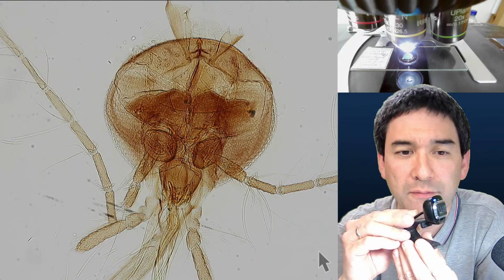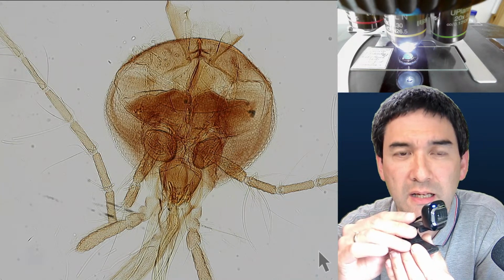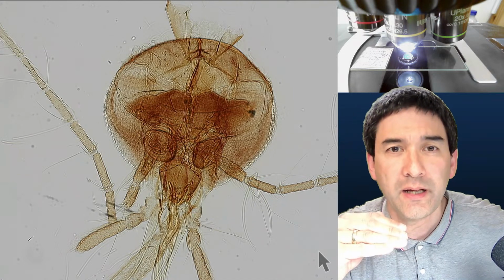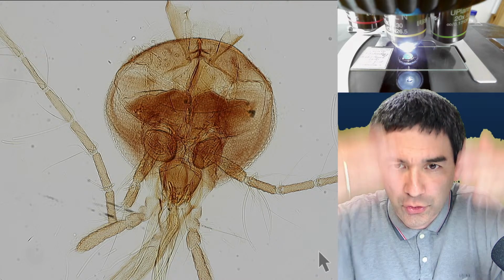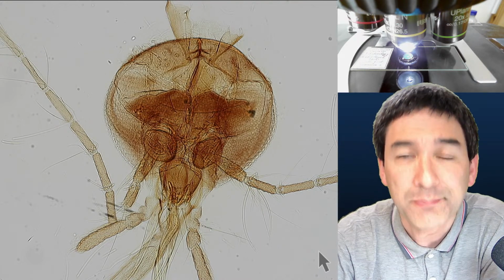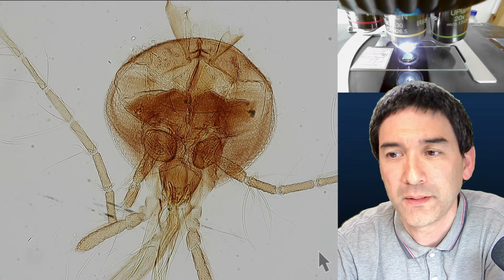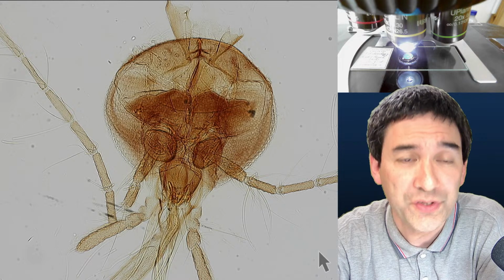In a picture like this, the camera should not be rotating, but there is a horizontal movement, and that is very different geometry. You also want to stitch in two dimensions, not just in one direction but also vertically, right? Not all panorama software is able to do that, but this MS ICE program is. And you do not even need to combine different images. You can actually take a video. It is very convenient, and I would like to show this to you now.